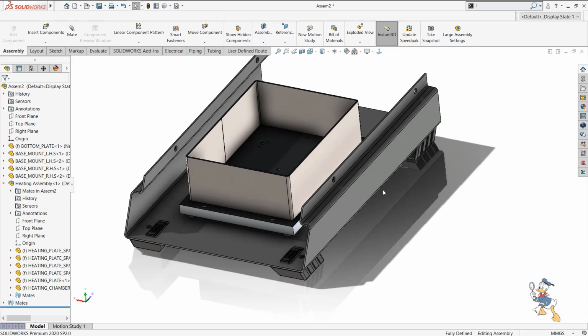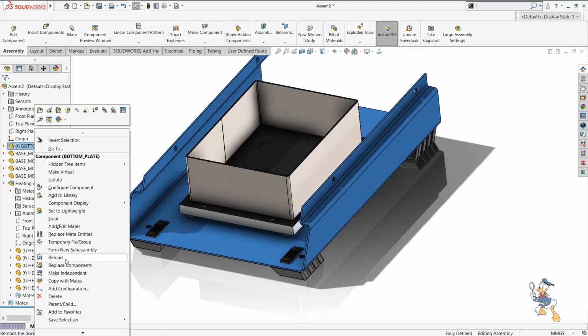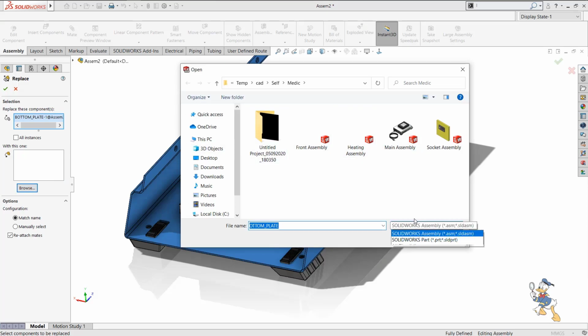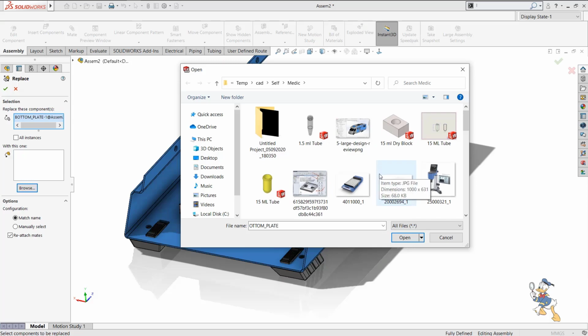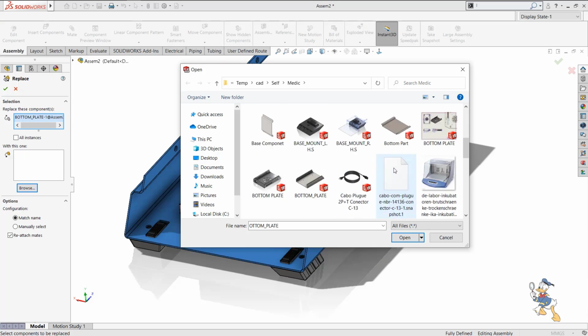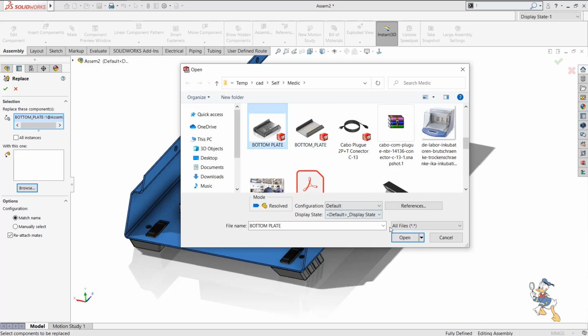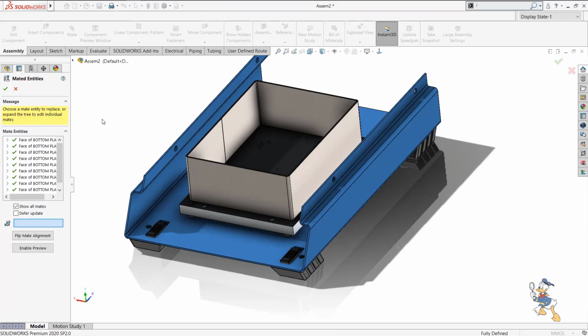Okay, suppose we need to replace that component with some other component, so we just need to choose the replace component feature from the tree. Replace component is here, and I need to replace it with another part which we have designed. So we can select that part from the assembly. Bottom plate is this.